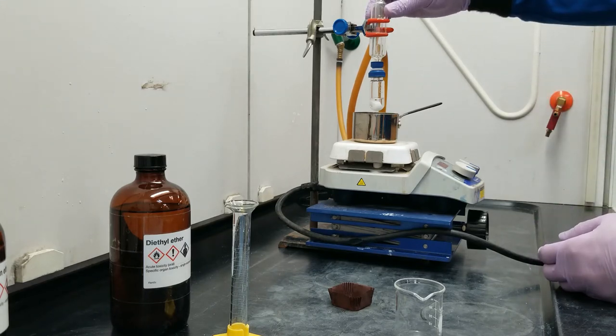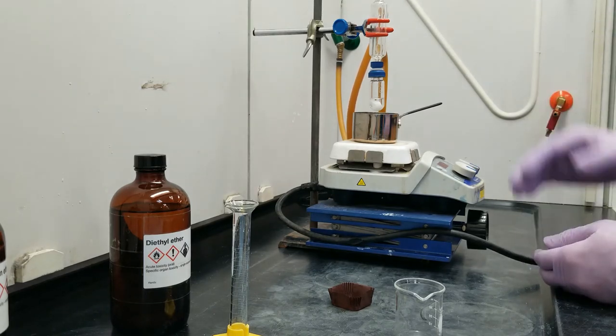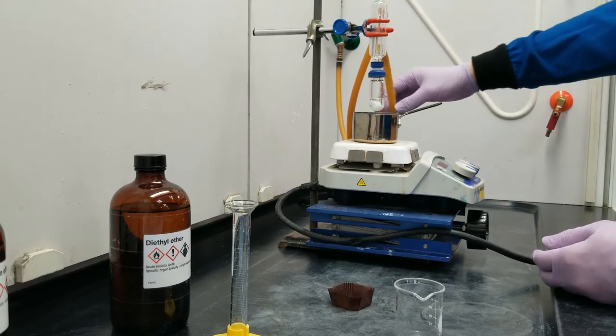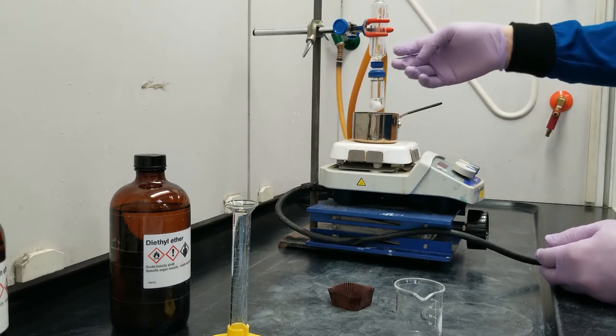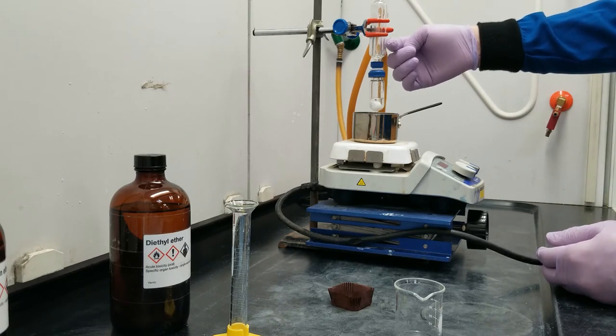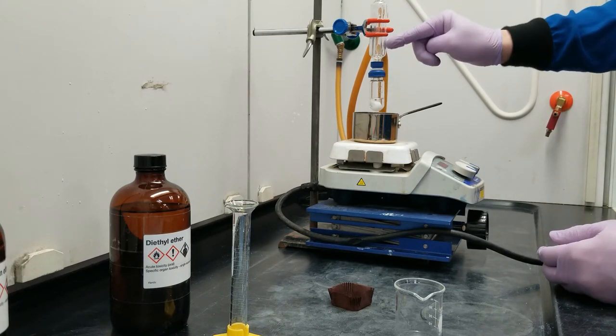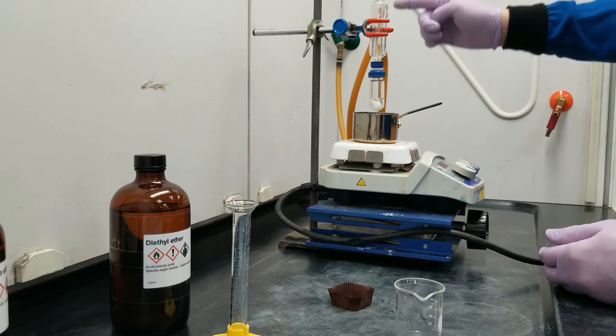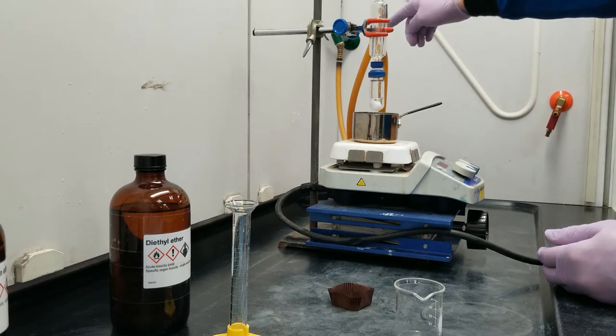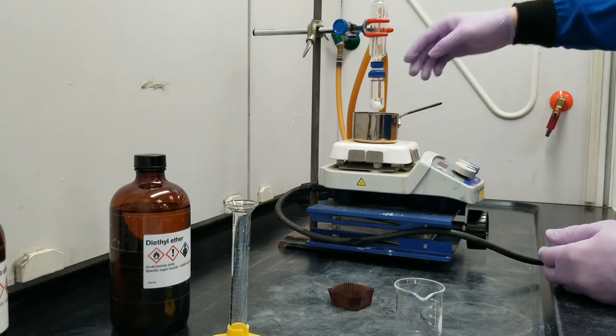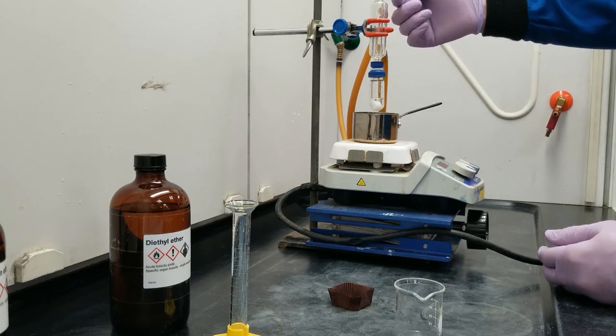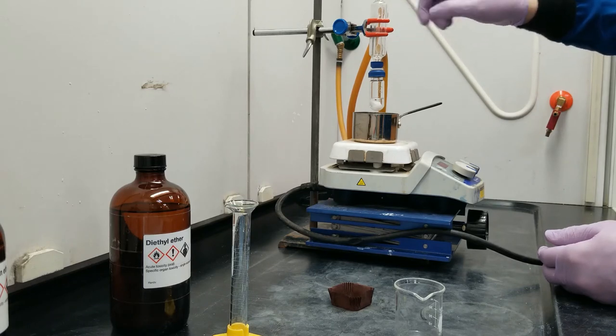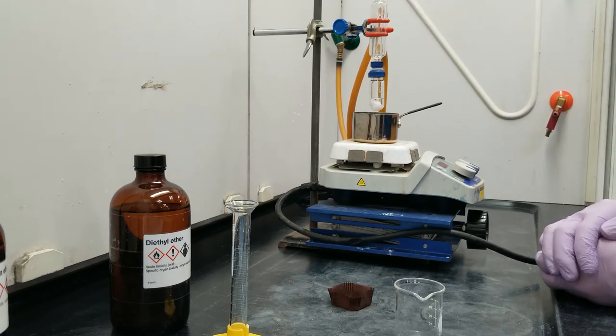Before heating, I'm also going to turn on the water in this water jacket and condenser. And I'm going to do this by hooking it up to my water source back here. The water comes in the bottom, because then it needs to fill up the entire volume of this jacket before it can leave out the top and out to my sink. A mistake that some people make is to fill from the top, that then it can actually just run down the side and escape without effectively cooling the inside of this tube.